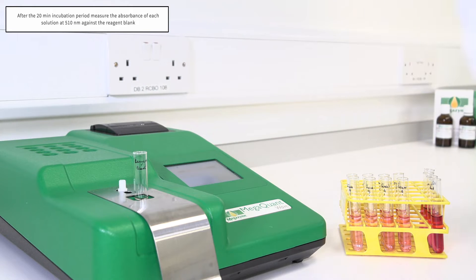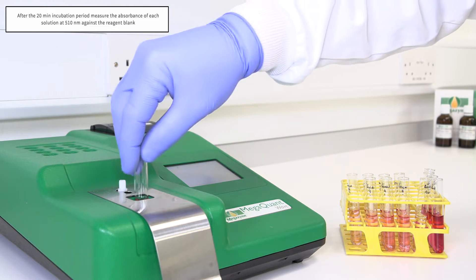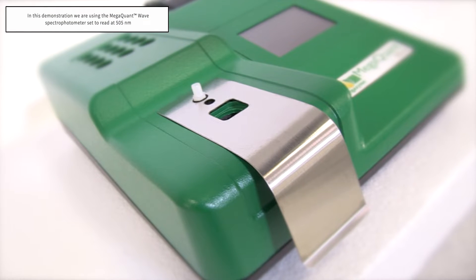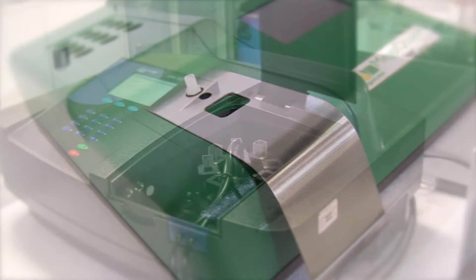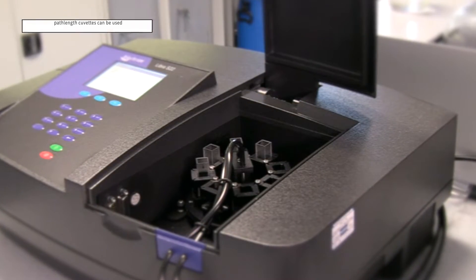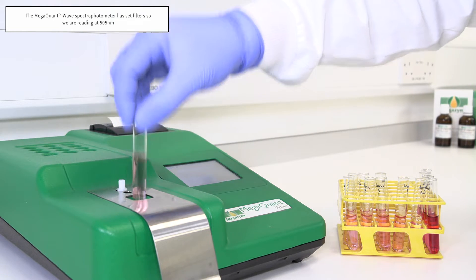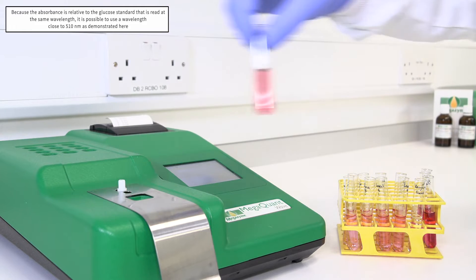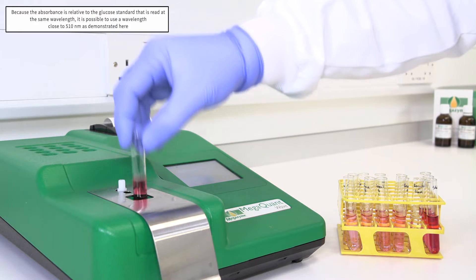After the 20 minute incubation period, measure the absorbance of each solution at 510 nm against the reagent blank. In this demonstration we are using the MegaQuant Wave spectrophotometer set to read at 505 nm. Alternatively, a recording spectrophotometer with 1 cm path length cuvettes can be used. The MegaQuant Wave spectrophotometer has set filters so we are reading at 505 nm. Because the absorbance is relative to the glucose standard that is read at the same wavelength, it is possible to use a wavelength close to 510 nm as demonstrated here.